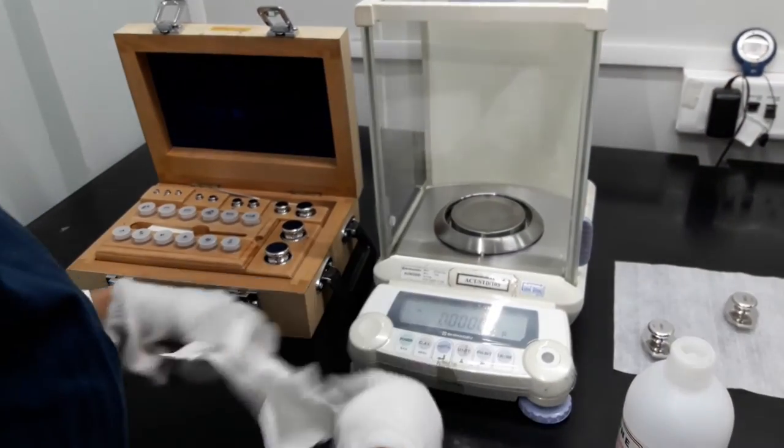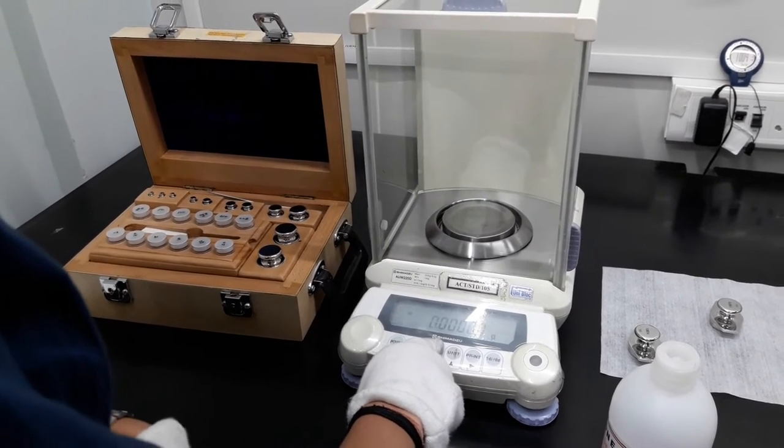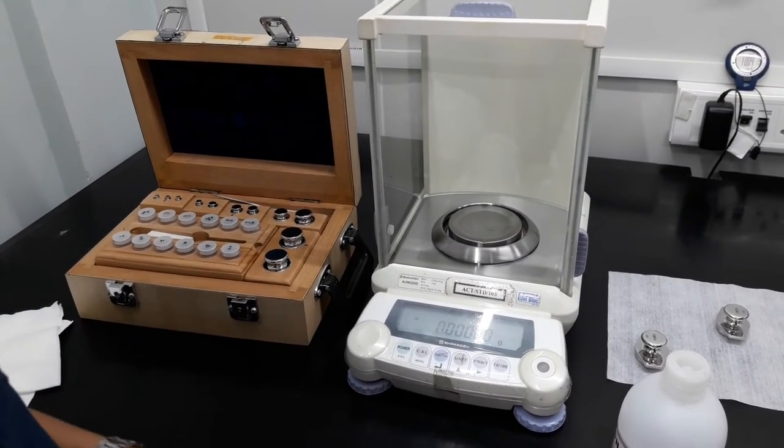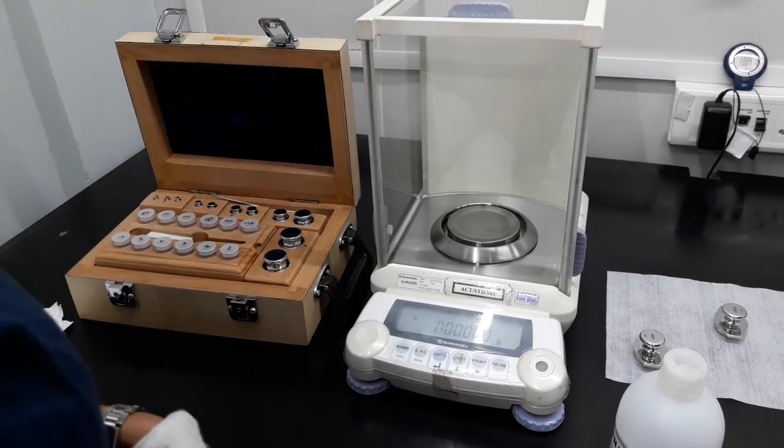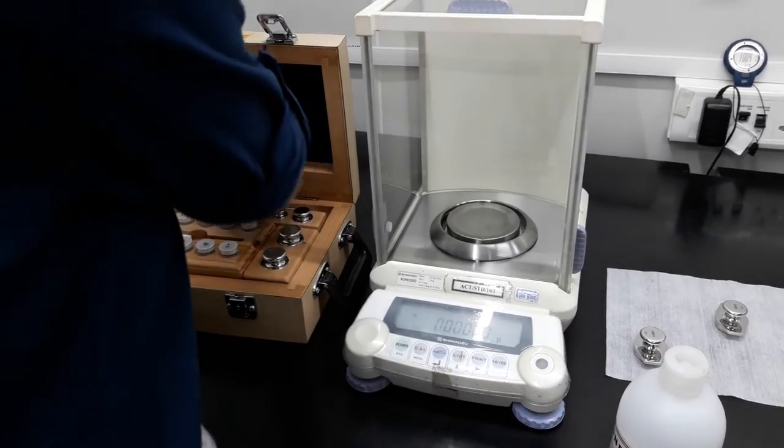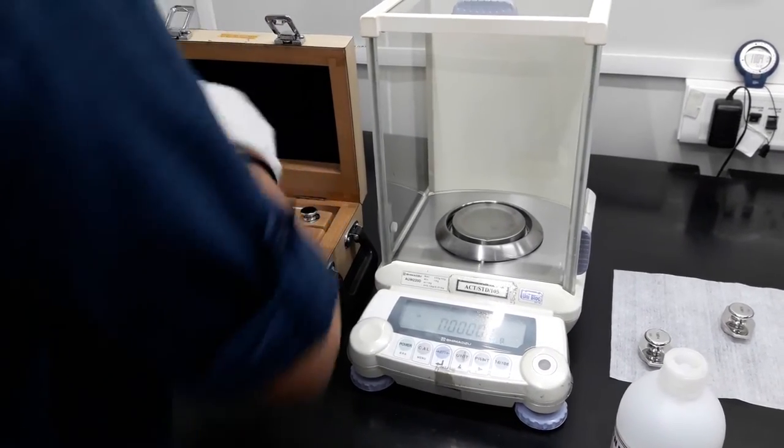Press the clear button on the weighing balance to ensure zero reading. Use tweezers to lift the weight in order to avoid any external impurity.